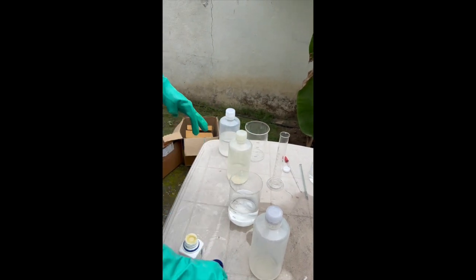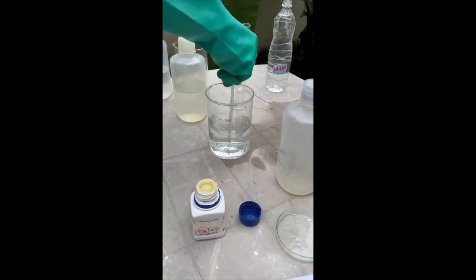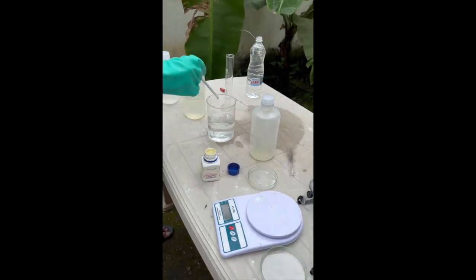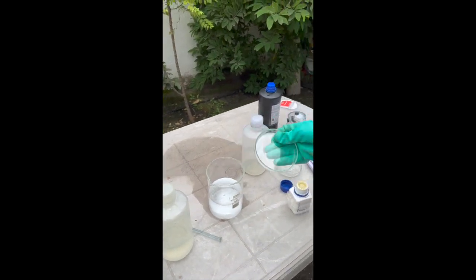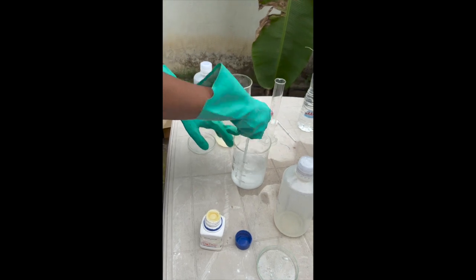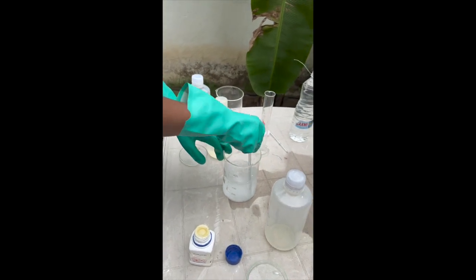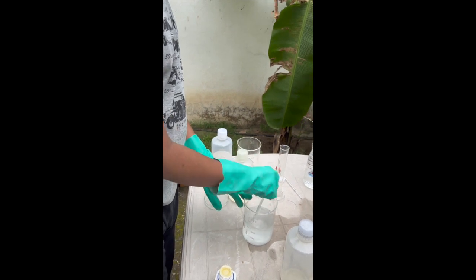Later, I used kitchen science and just poured in all the malonic acid which dissolved very quickly. So next, I put approximately 2 grams of manganese sulfate in the 450 ml of distilled water and malonic acid and I stirred it strongly.